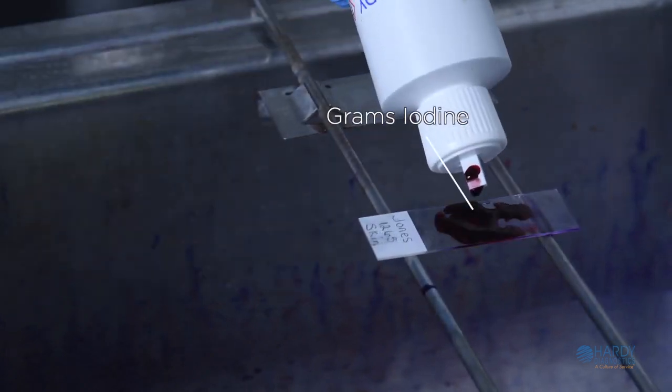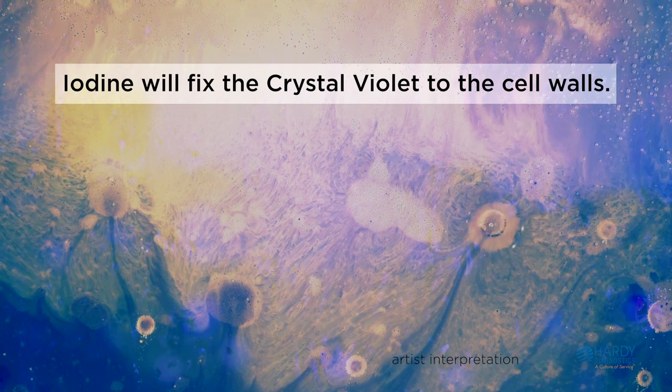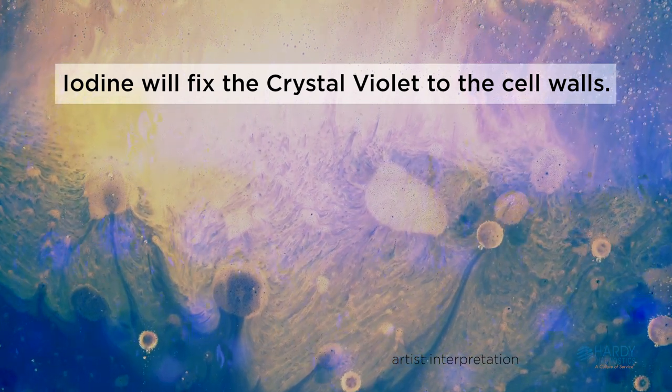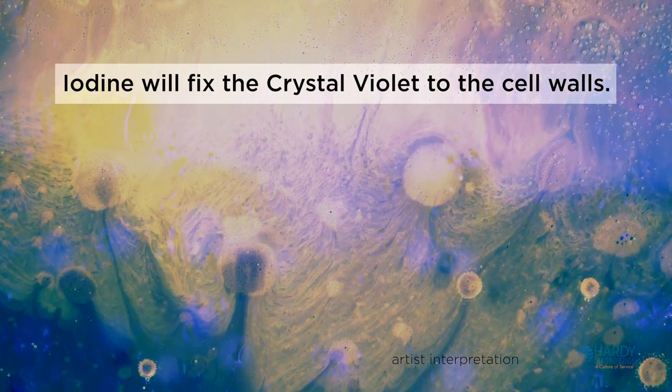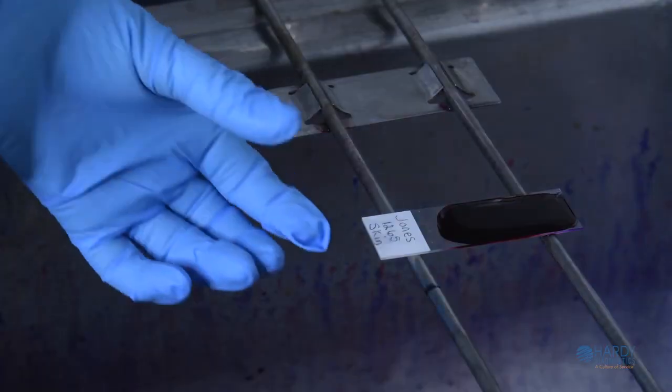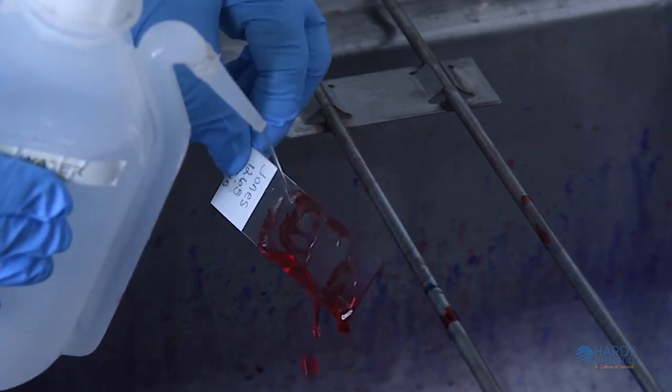Flood the slide with Gram's iodine for 1 minute. The negatively charged iodine molecules act as a mordant and link to the positively charged crystal violet. This traps the crystal violet in the peptidoglycan layer. Once 1 minute is up, rinse off the Gram's iodine with deionized or tap water.